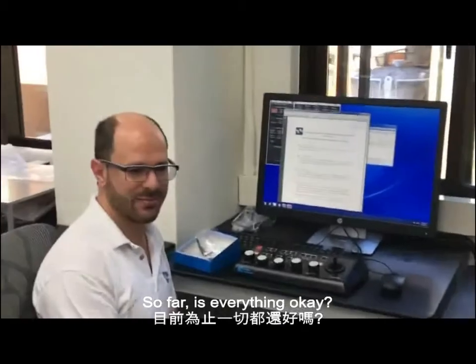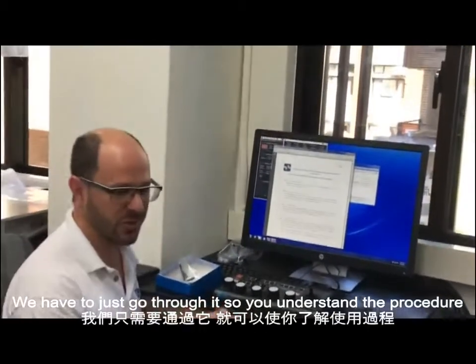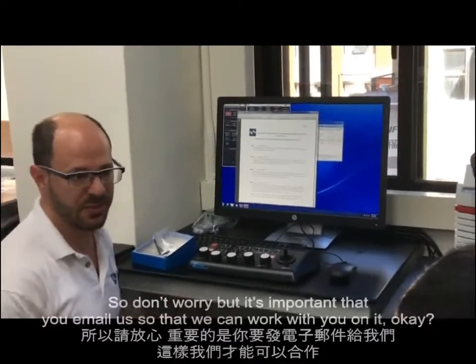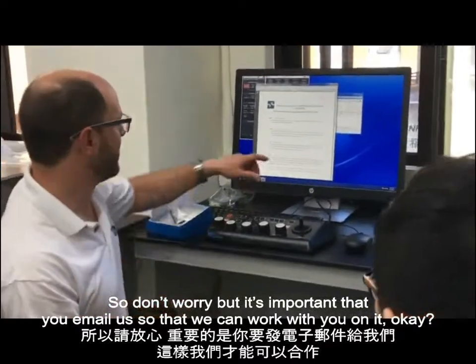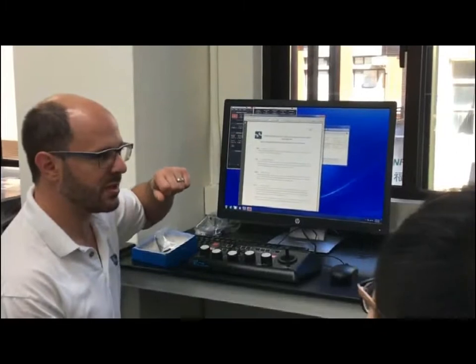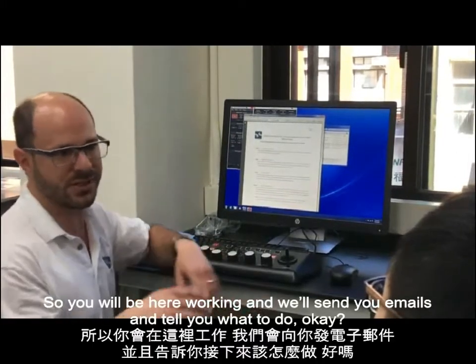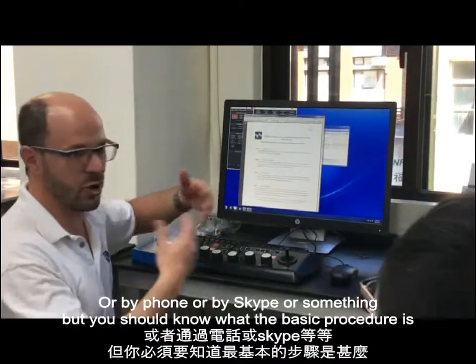Okay, so far is it okay? Yeah? We're going to help you through this type of thing. We have to just go through it so you understand the procedure, but we'll work on this with you by email and by phone or Skype. So don't worry, but it's important that you email us so that we can work with you on it, okay? So you wait 20 minutes. I should not do it myself? Yeah, best you should work with us. So you'll be here working and we'll send you emails and tell you what to do. Okay? Or by phone or by Skype or something else. But you should know what the basic procedure is.